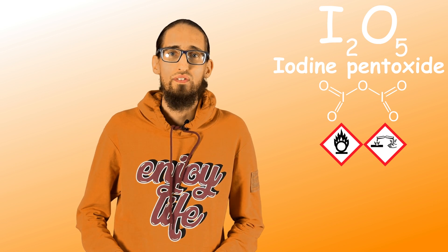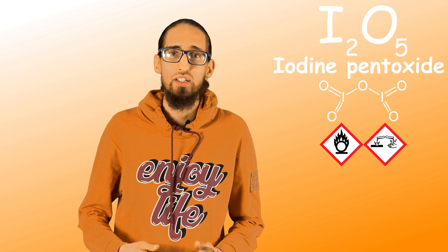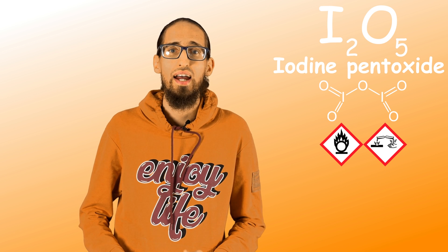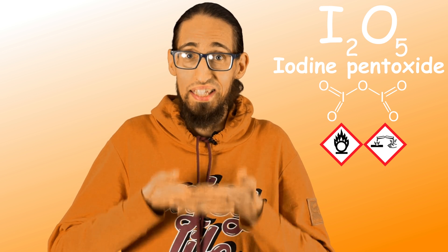The main point of this video was to show this very well-known analytical reaction for detecting carbon monoxide in the atmosphere.